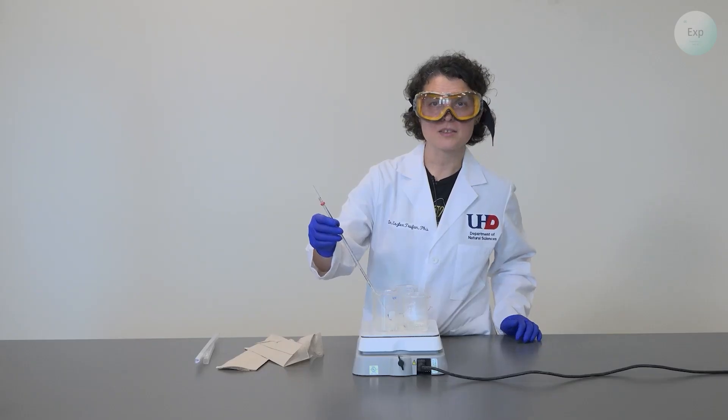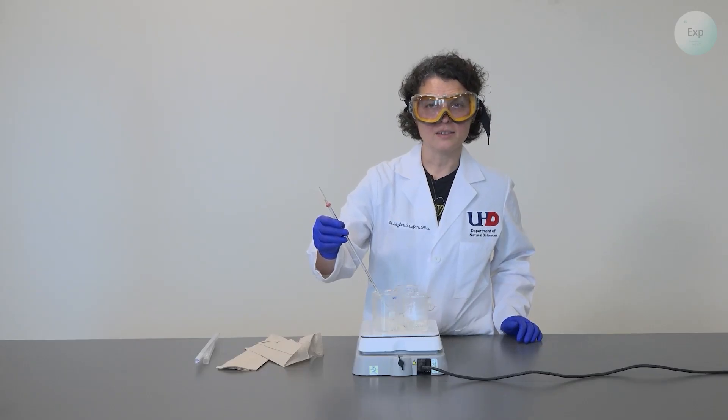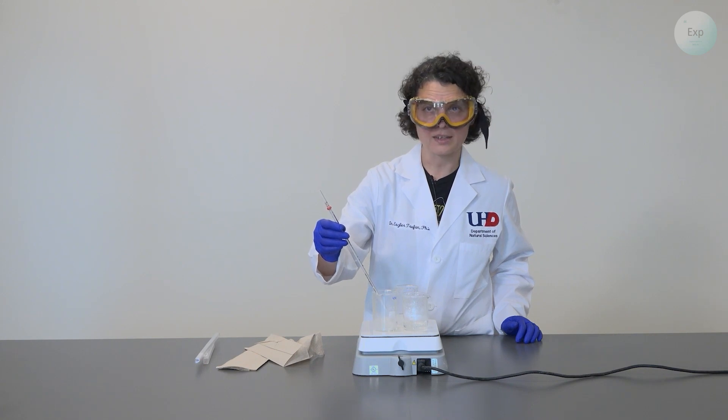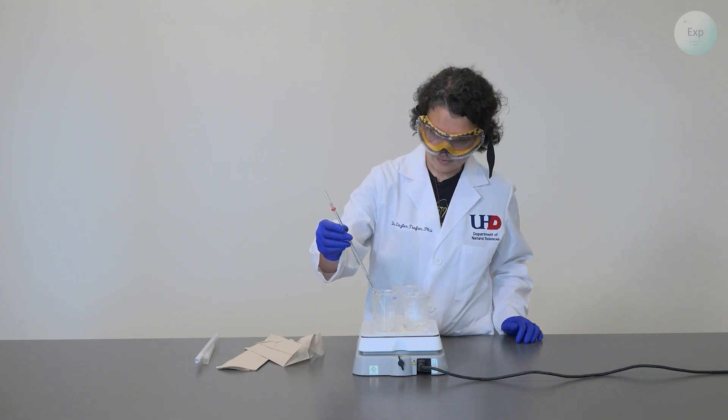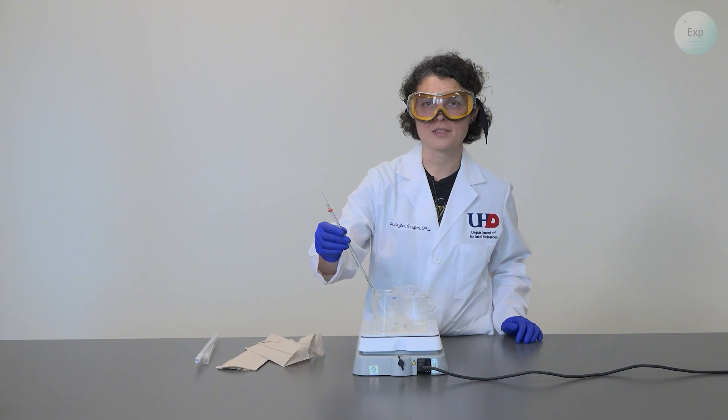I will give it a couple minutes and check again but I don't want the boiling to go for too long because then too much of my water will be gone. The temperature remains steady at 101.0 degrees Celsius.